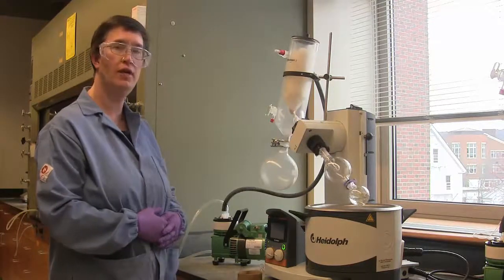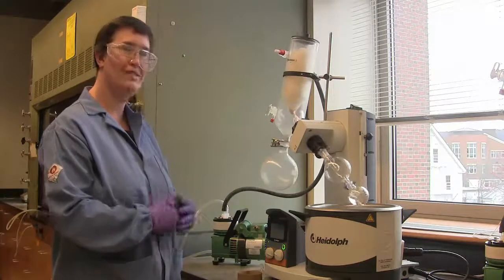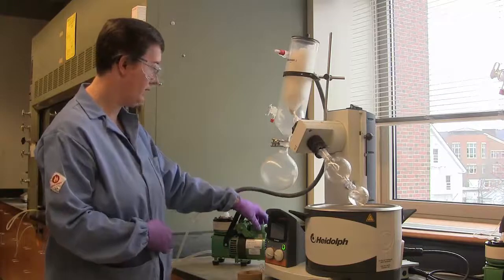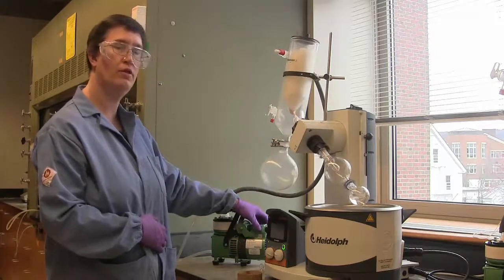This will be loud, so I'm going to give the pump a little bit of time to pump down, and then I'll come back and explain some more. Flipping on the pump, and closing the vacuum valve.